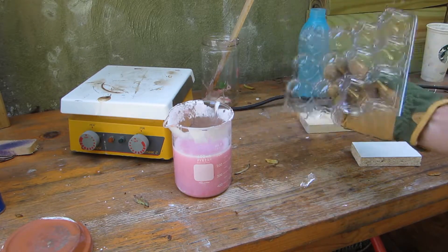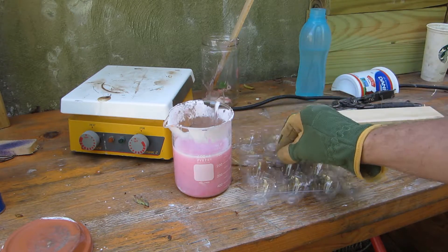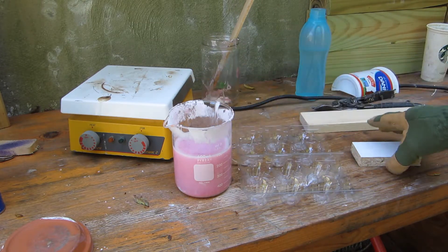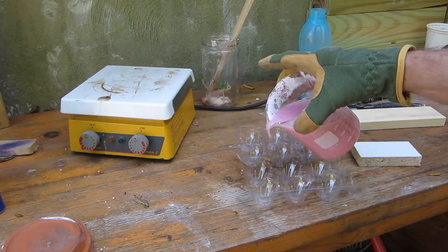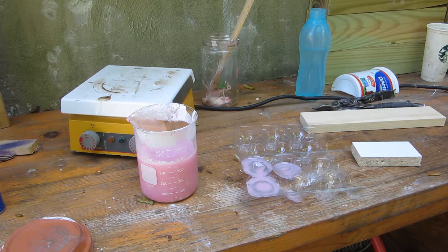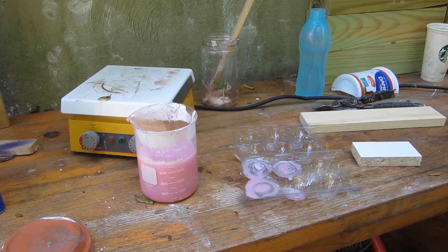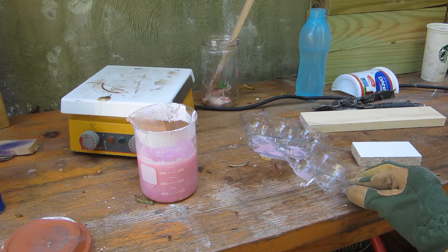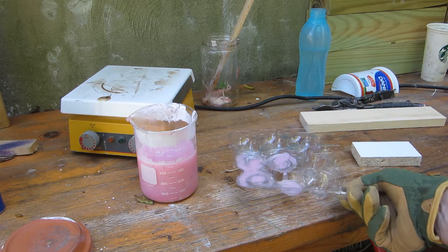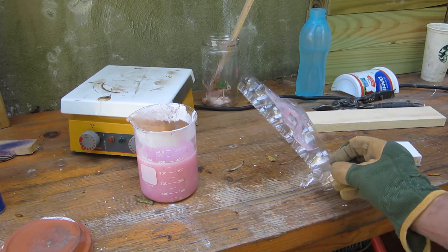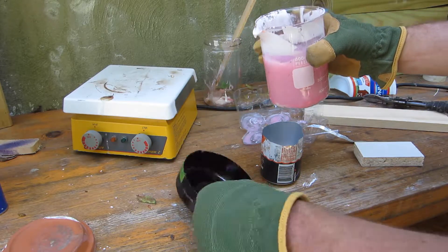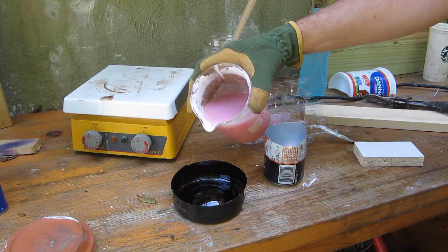I got a few things going on here. I've got the PET, the polyethylene terephthalate, that's your number one. Like I said before, I don't think this will dissolve it, although I don't think I had the xylene that hot. I'm just gonna pour a little bit into one of these cups and the cup portion just sucked right up there, just went flat. That's not what I expected to happen. I got a bottom of a much more robust PET container, put a little in there and see what happens.